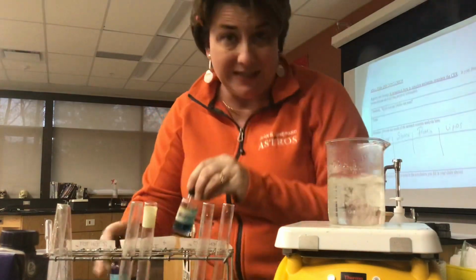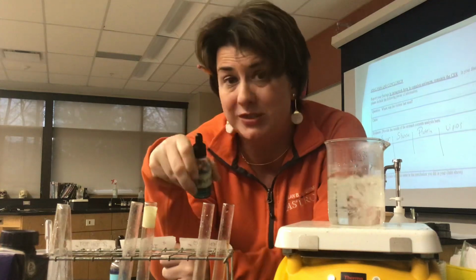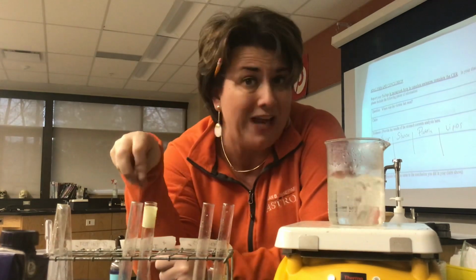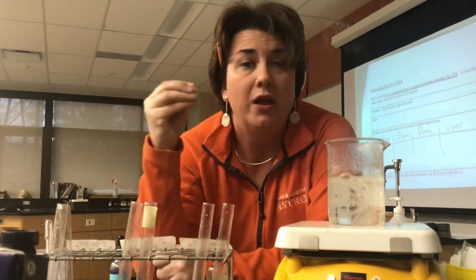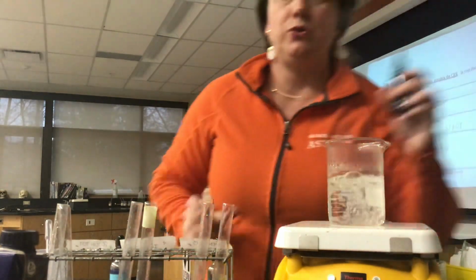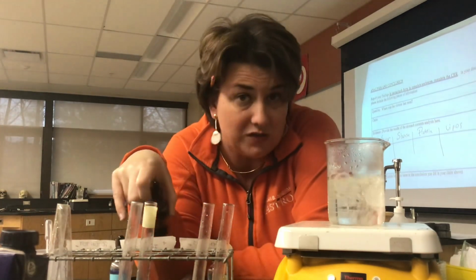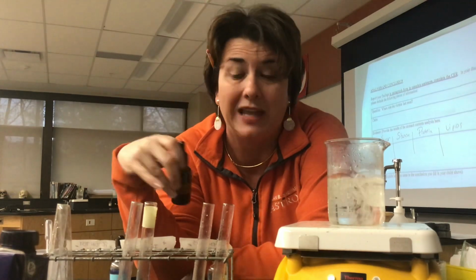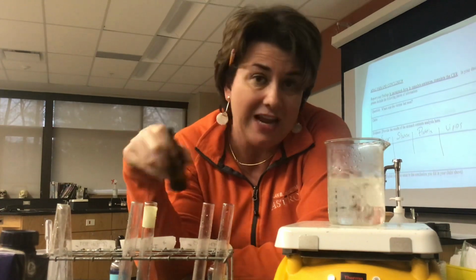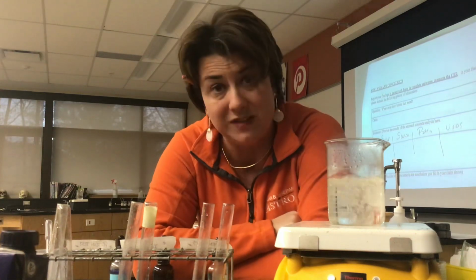One is called Benedict's. Benedict's tests for simple sugars, meaning sugars that seem sweet. So we're going to use Benedict's to help us test for something we know has sugar in it, and then obviously with water, so we know what something that doesn't have sugar looks like. The second reagent we're going to use is called iodine. Iodine tests for the presence of starches. Starches are also sugars, but they're bigger, they're more complicated, and they're a good way to indicate whether a starch is present. So today I'm going to use something that I know has starch in it, and then obviously water is going to serve as my example of something that does not.